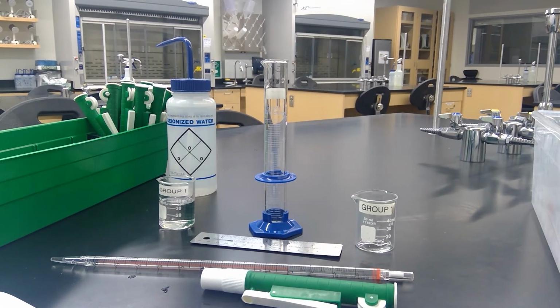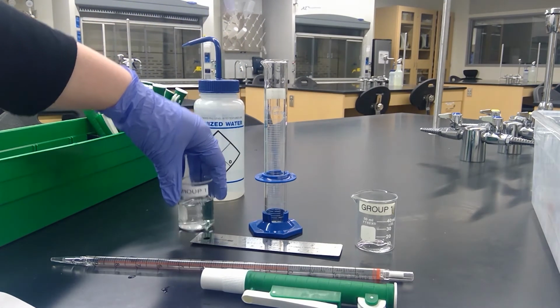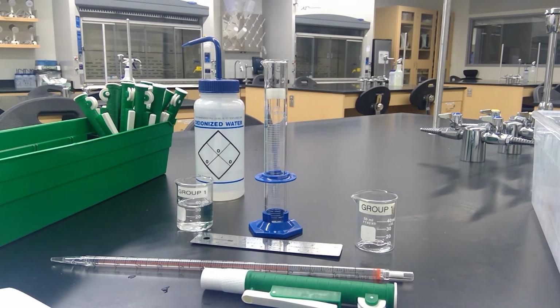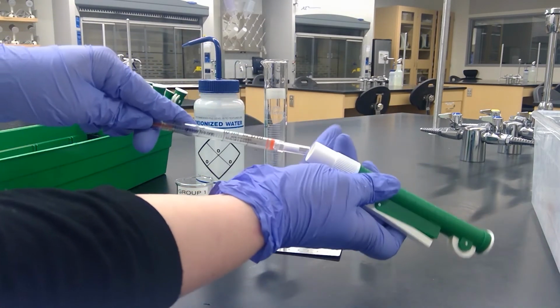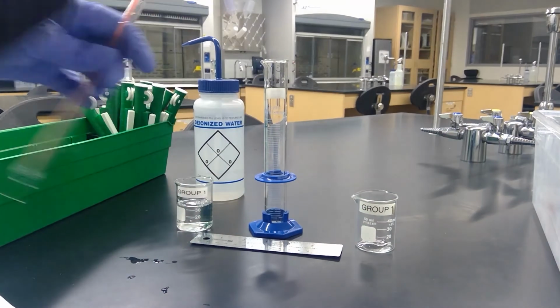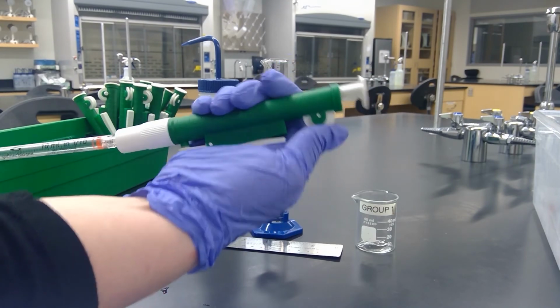Half fill one of the 50 ml beakers with deionized water from the squeeze bottle on your bench. So that's this, and I already filled it with some DI water. This beaker is only a reservoir to take water out of. Do not take any measurements with this beaker. Next, measure out slightly more than 10 ml of water using the 10 ml pipette and pump. So you'll attach the pipette pump, and then to draw up water, you just use that.